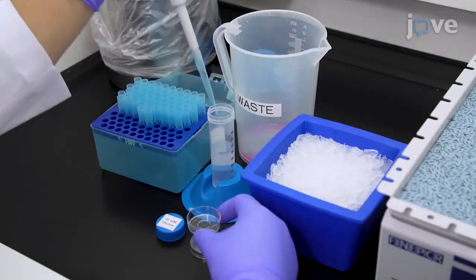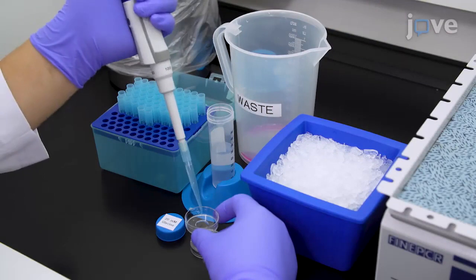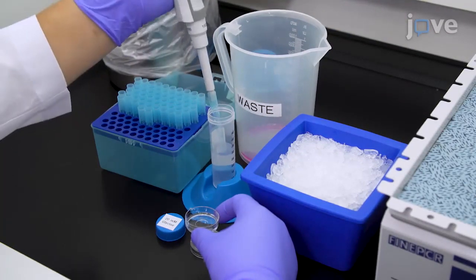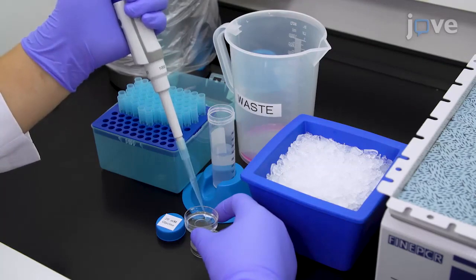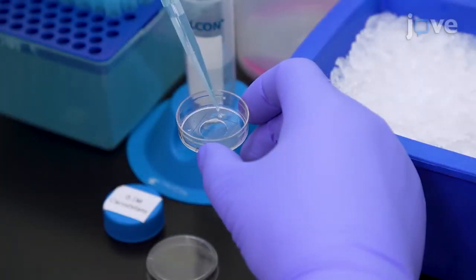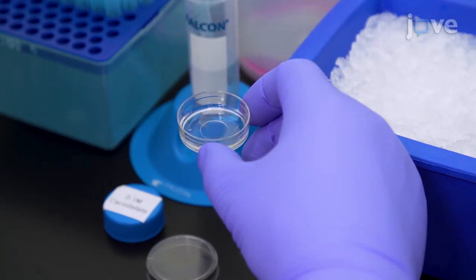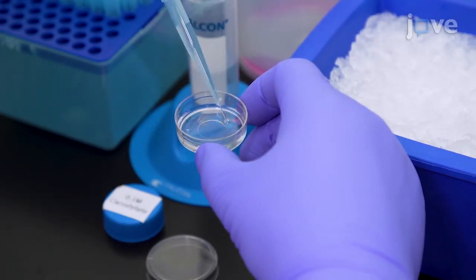After the last wash, add 1 milliliter of ice-cold 0 to 4 degrees Celsius 20 millimolar glycine solution to the dish for a 10-minute incubation on ice, followed by 3 5-minute washes with 1 milliliter of fresh, cold, 0.1 molar sodium cacodylate buffer per wash.